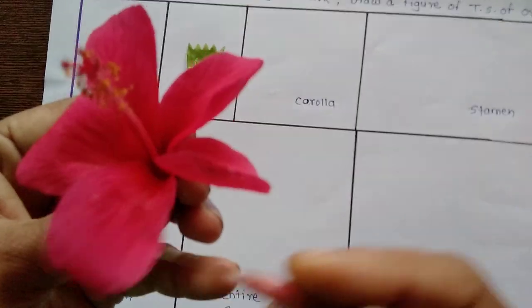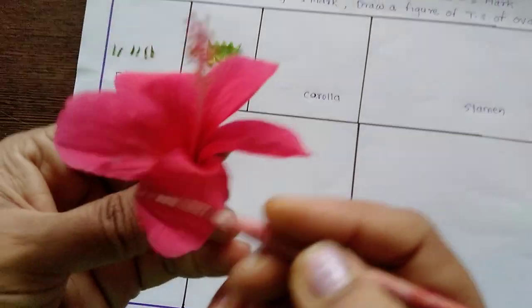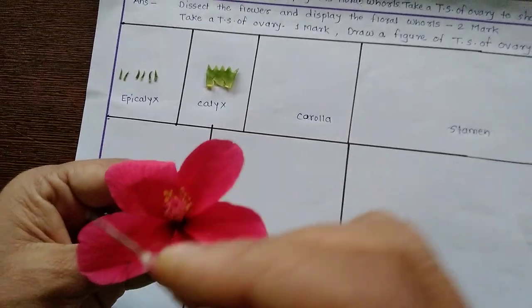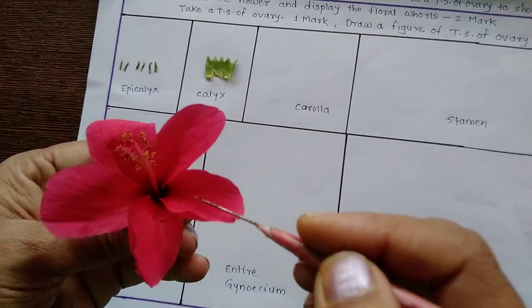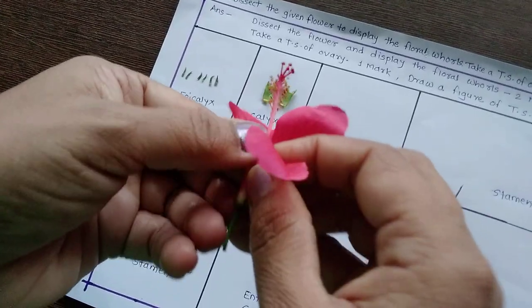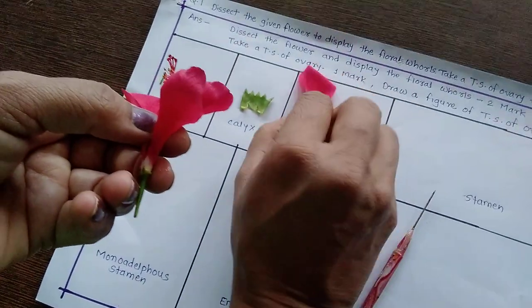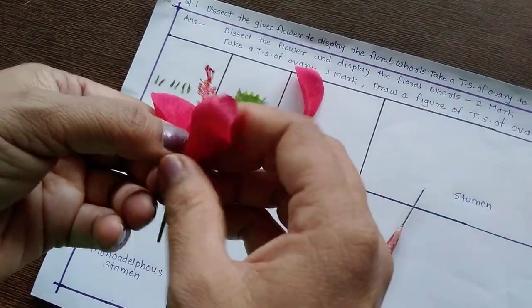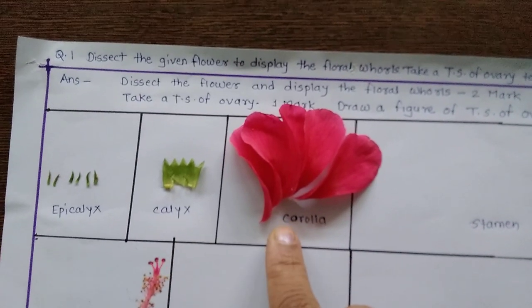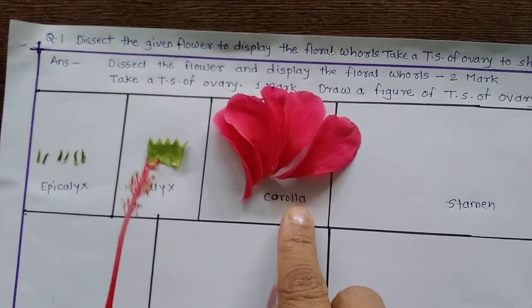These are the bright colored petals and the complete whorl of these petals is called corolla. Remove these petals one by one and display the corolla in that manner.